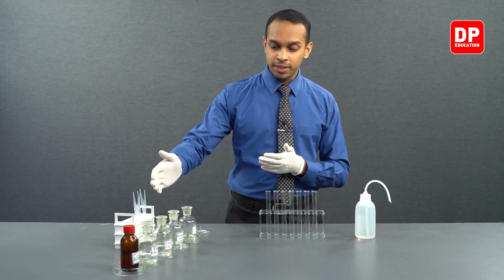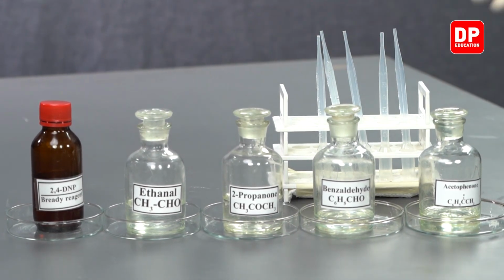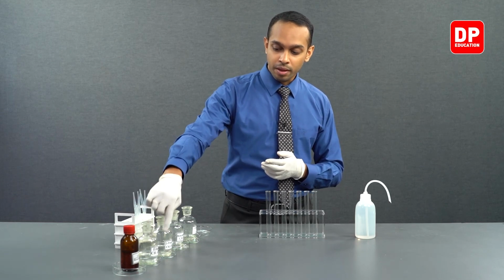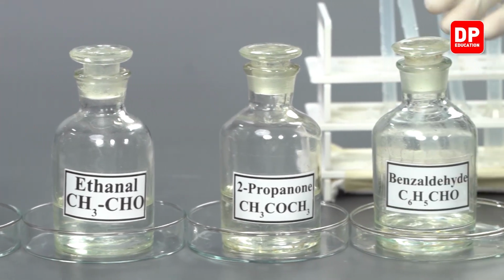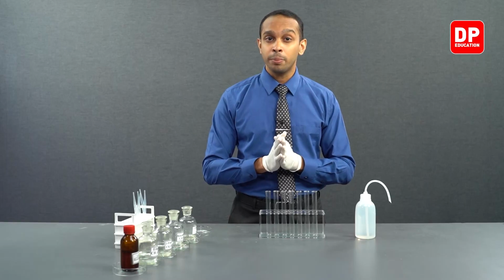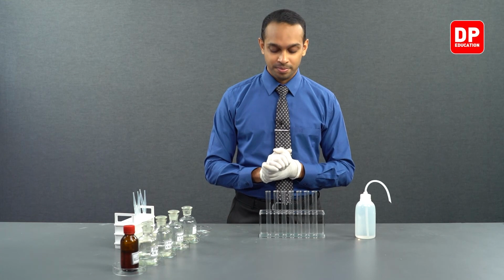So over here we have two aliphatic compounds and two aromatic compounds. What we have here is an aliphatic aldehyde, an aliphatic ketone, and then we have an aromatic aldehyde and an aromatic ketone. So we are going to see how aliphatic carbonyl compounds and aromatic carbonyl compounds react with 2,4-DNP.